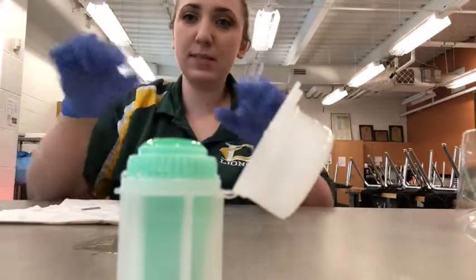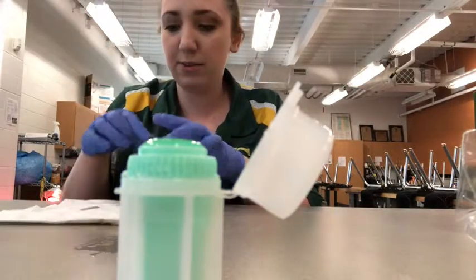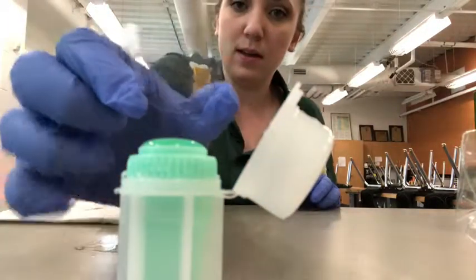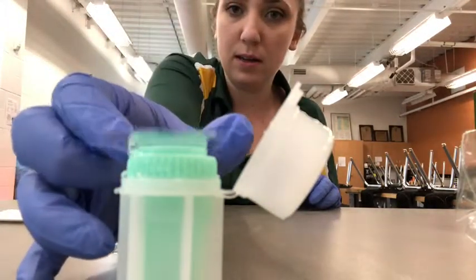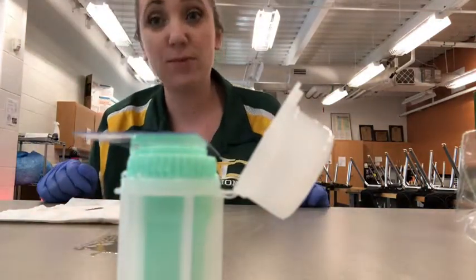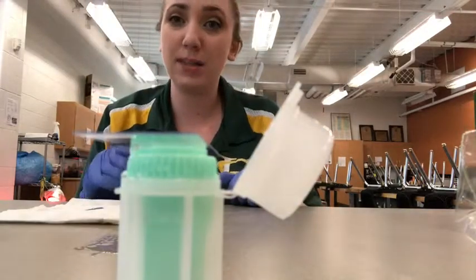Once you have the meniscus, you're going to place your slide, a clean slide. Make sure it's dried off and clean if you're using glass, or a fresh slide sample. And you're just going to let it rest there. You will leave it to rest for 10 minutes. That allows all the eggs to rise to the top so that we can get a good look at them.